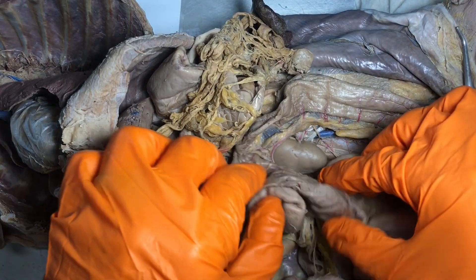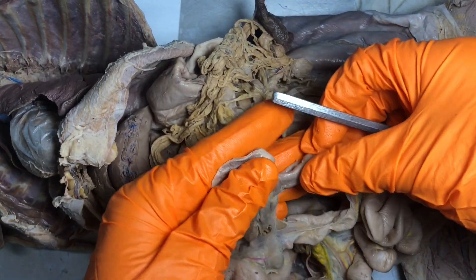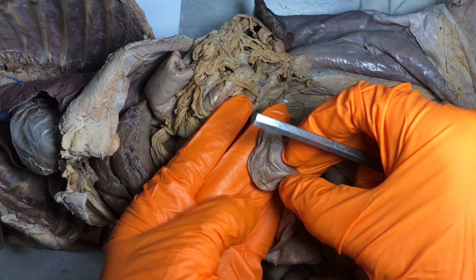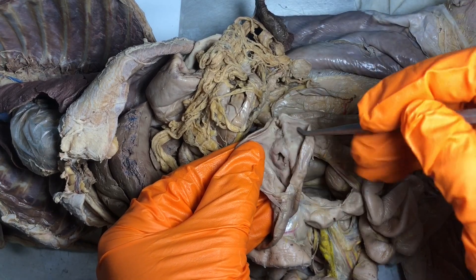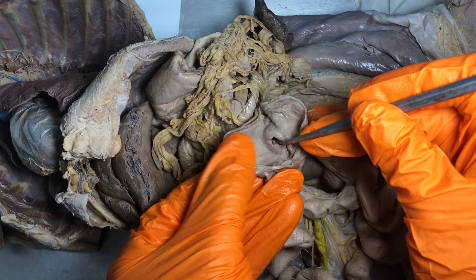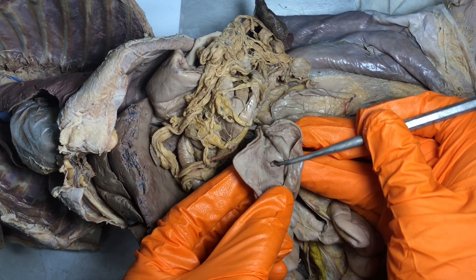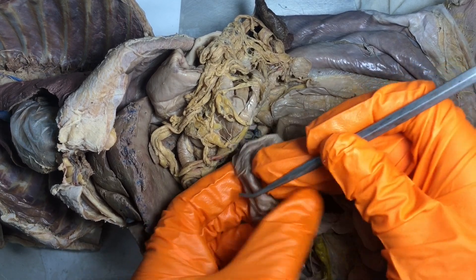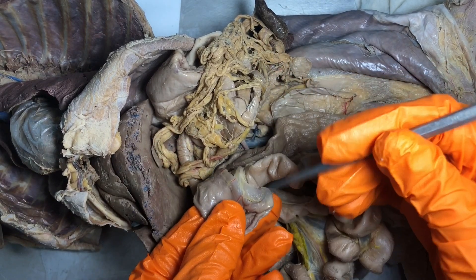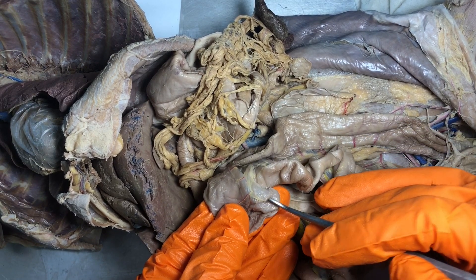If we were to open up the cecum, which is the first part of the large intestine — let me put it in my hand so you can see it better — here we have the small intestine and the large intestine. If we open that up, here we have the ileocecal valve. This thing that looks like a little inny belly button, that is the ileocecal valve. Ileocecal is a compound word made up of ileum and cecum. In humans, this is where we would find the vermiform appendix, but kitties do not have one, so that's not a structure you'd have to find on a feline specimen.